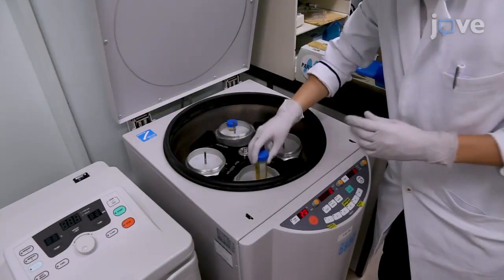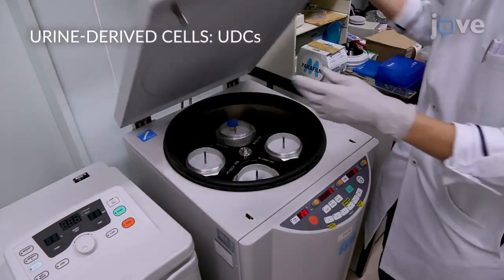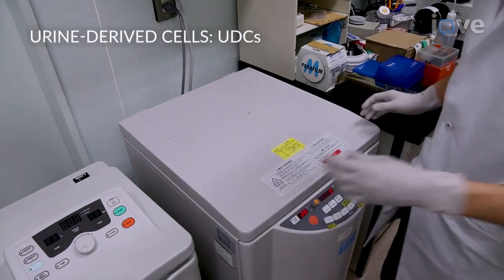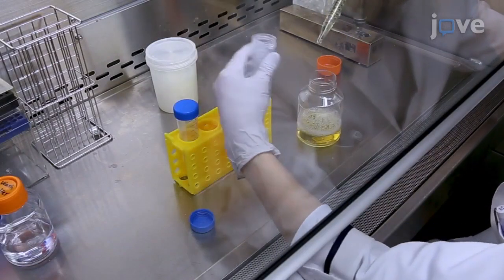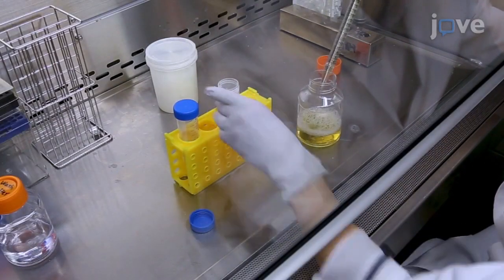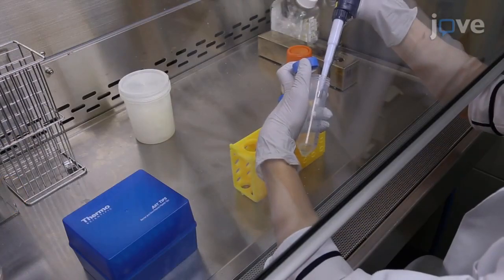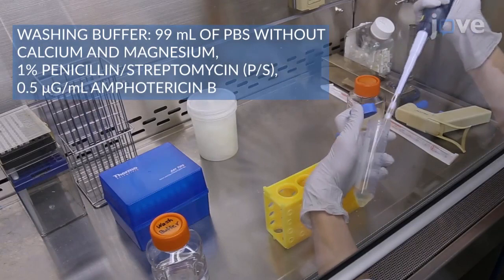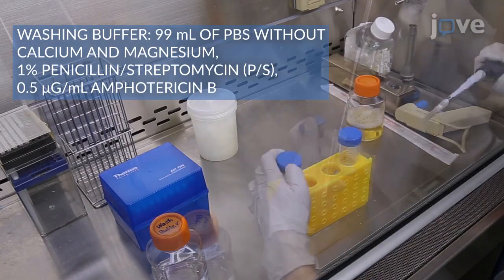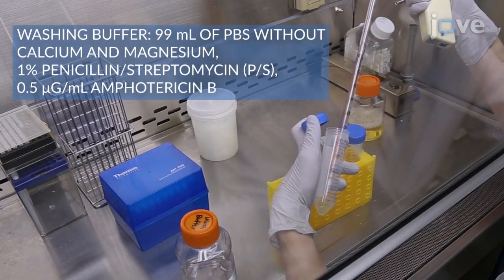To begin, centrifuge the entire urine sample at 400 times G for 10 minutes at room temperature. Next, aspirate the supernatant, leaving 1 milliliter in the tube. Resuspend the pellets individually in the remaining 1 milliliter of urine. Collect those in a single 50 milliliter tube and add 10 milliliters of washing buffer to the tube.